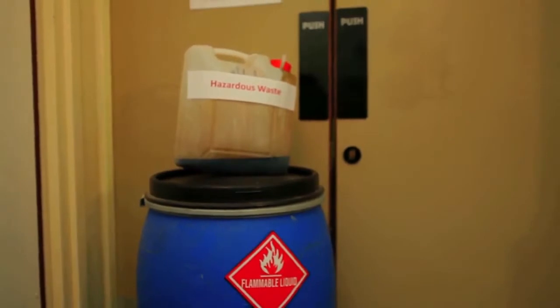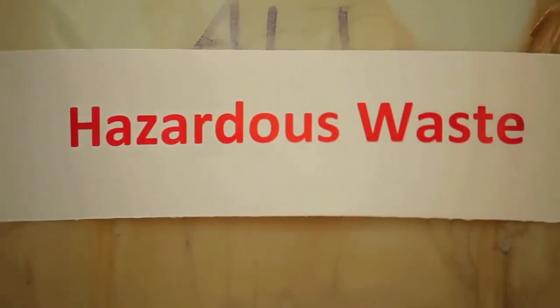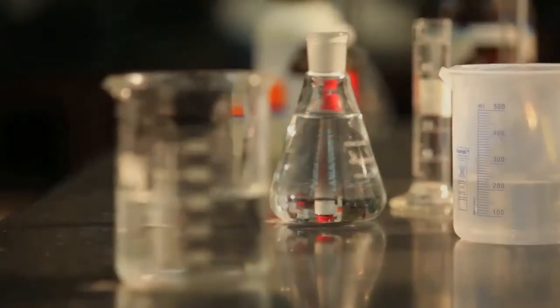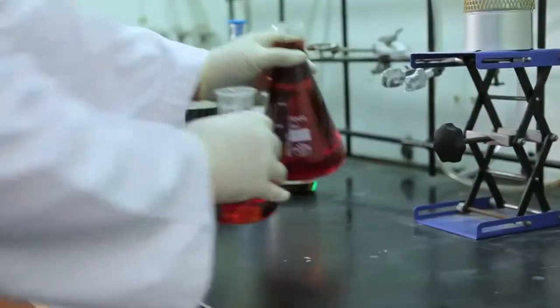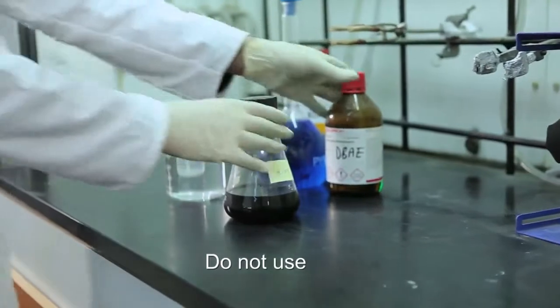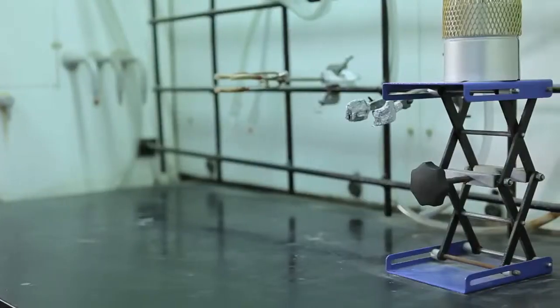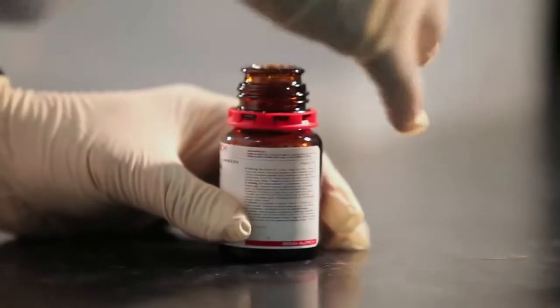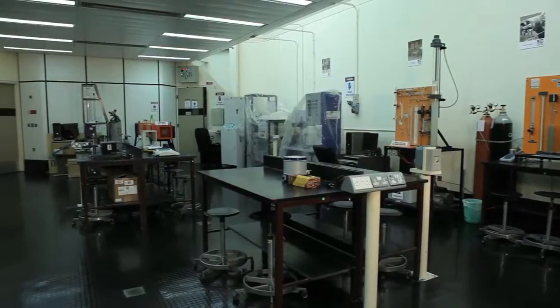The vapour content in flammable material containers may still pose a potential hazard; therefore, properly dispose of all empty or unnecessary containers in the lab. Fume hoods must be carefully operated, maintained and kept free of unnecessary clutter. Do not use fume hoods for storage. Organise and minimise necessary chemicals and equipment. Keep chemical containers within the fume hood closed. Ensure proper functioning of audible and visual alarms.